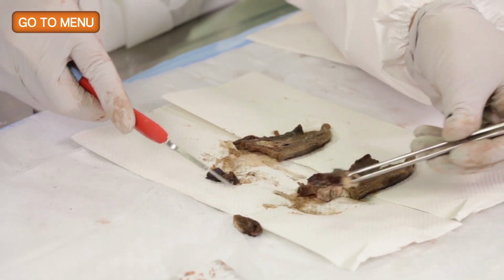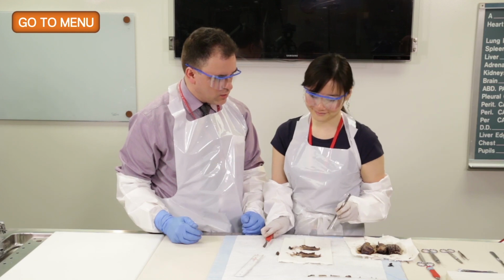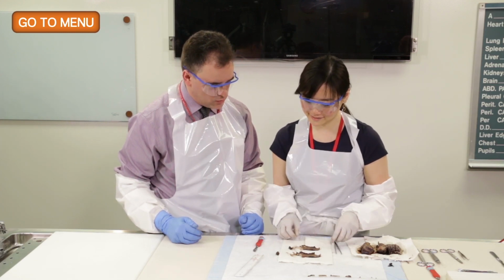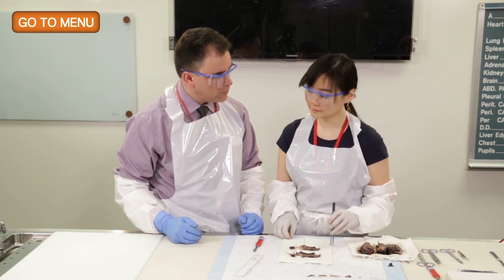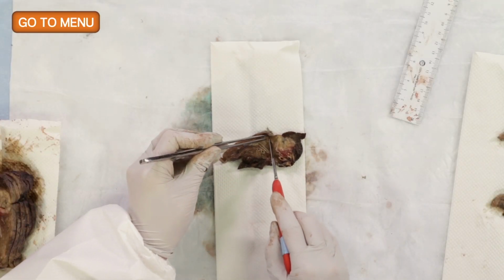And so now from the same slice, you're going to show a relationship of tumor to normal. And because you were so efficient with that one section, we're just at the verge of not having a section per centimeter. So you're going to take one more from somewhere that has tumor in it. Okay. And you could do that from the remainder of the specimen just to get a different sample from a different area.